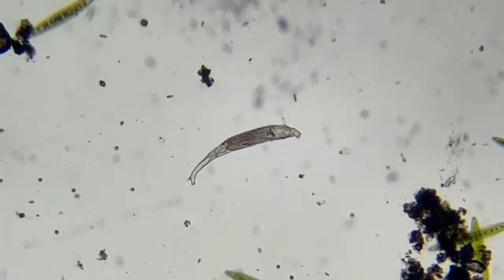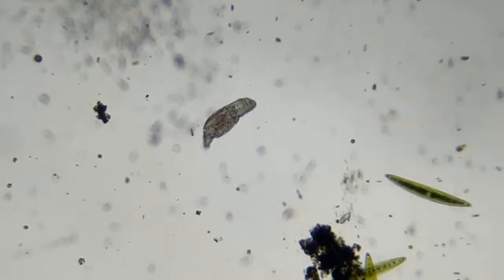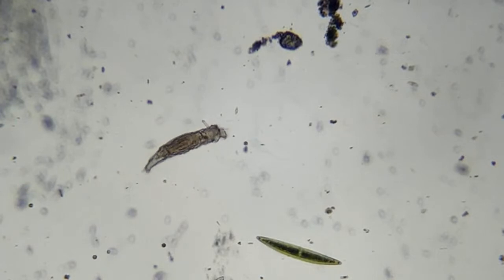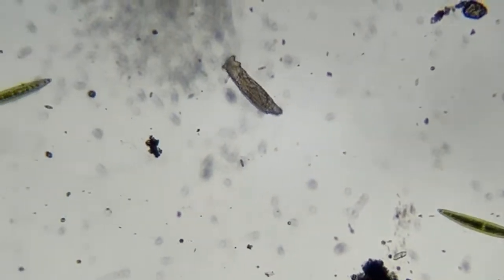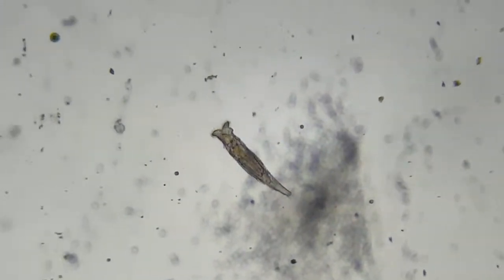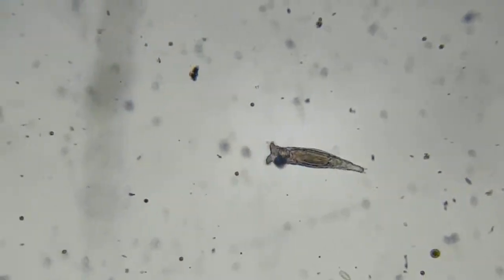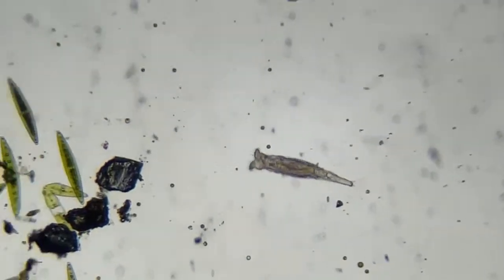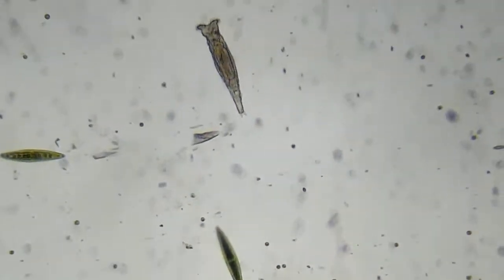The next big step would be a differential interference contrast microscope. And they get very expensive. When I say very expensive, I mean between $10,000 and $20,000. That would be the next big thing, and really, the next thing that would make a significant difference would be DIC, it's called.